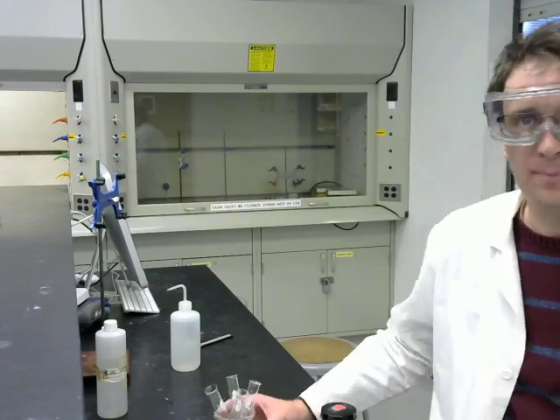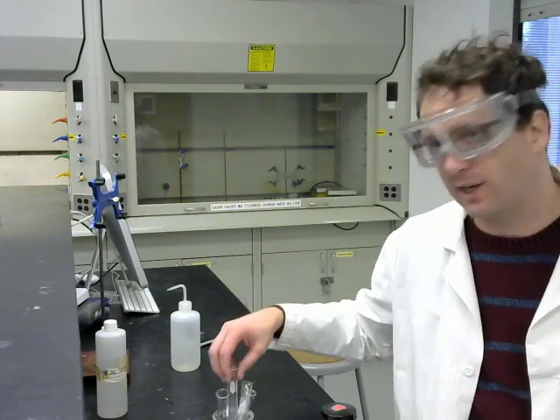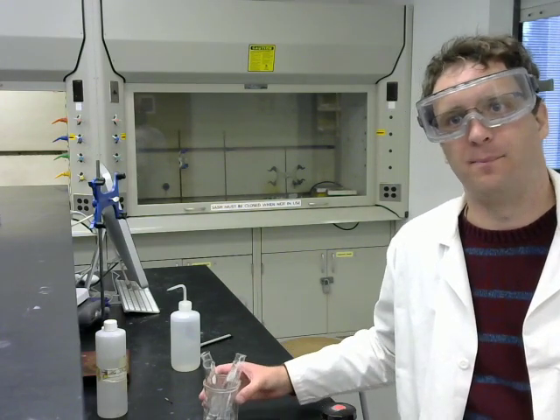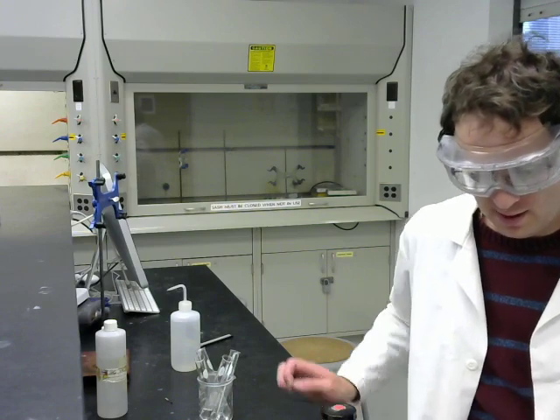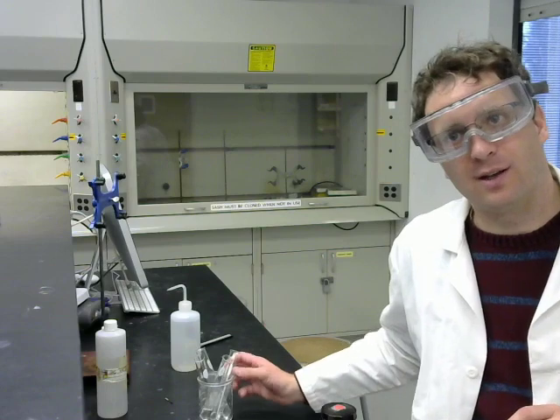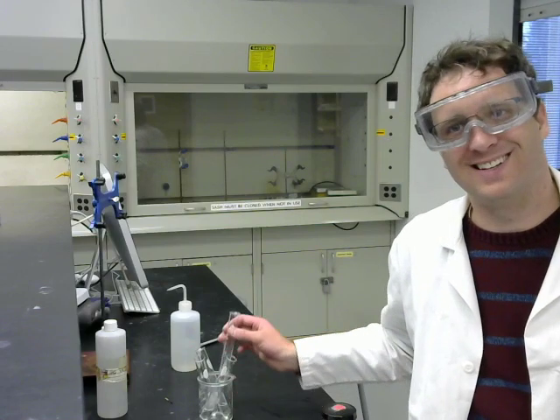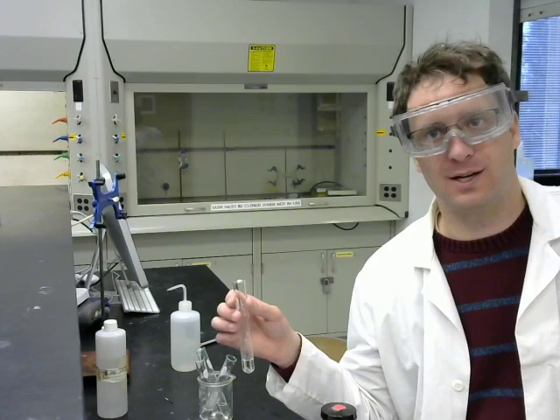Okay, so now we're doing the reactions of transition metals with acid. We have 4 test tubes here filled with 6 molar hydrochloric acid. And I know that the resolution of my camera may not be great, my videography is not very good, and you may be watching this on a cell phone, which would make it maybe hard for you to make fine comparisons. So I'm just going to say that I am doing these metals in a certain order for a certain reason, to help you with your interpretation of what you observe.